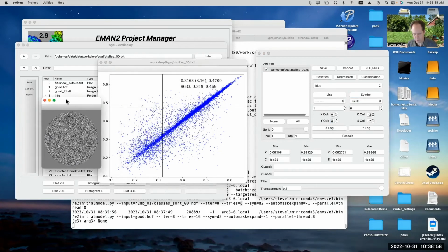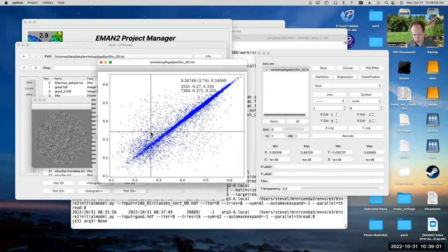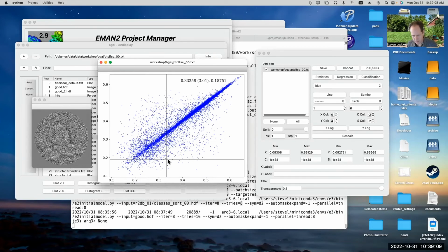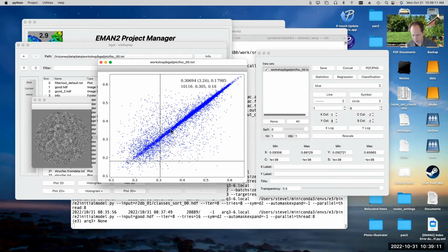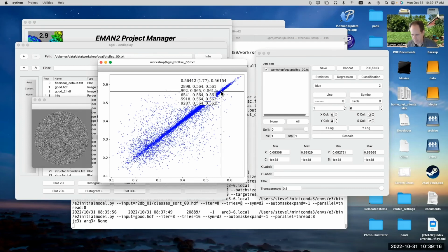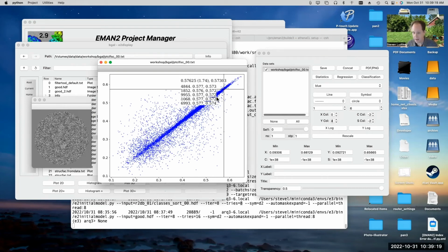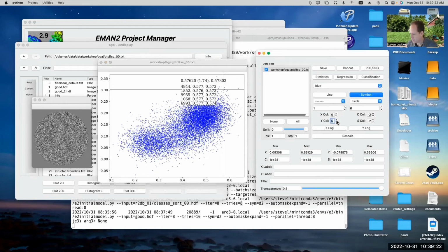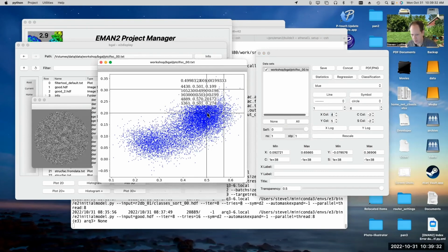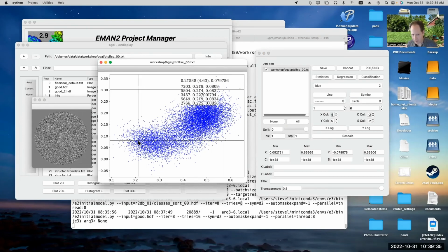Now, if I mouse over some of these things, it can actually show me the particles which correspond. Each time I move, you can see here, this is actually a little blob of ice contamination. There was some ice contamination. Anyway, if you mouse over these things, they should look like really nice particles. The conventional thing that we look at here is visualize 4 versus 5 or 0 versus 1, and you can see these 2 lobes. And generally, this is good. Stuff up here is good, and the stuff down here is bad.